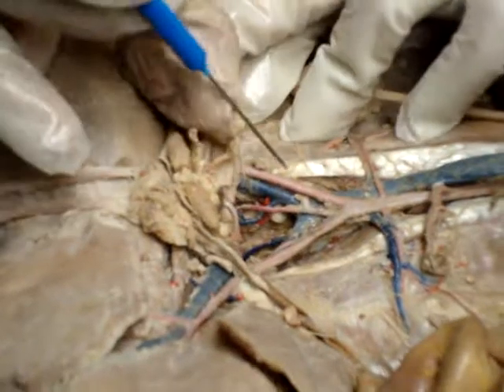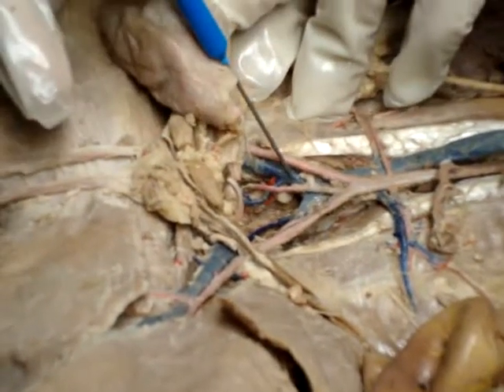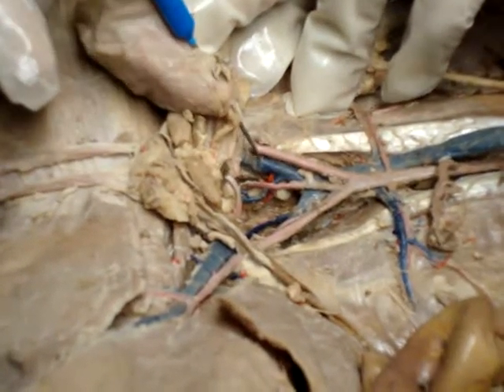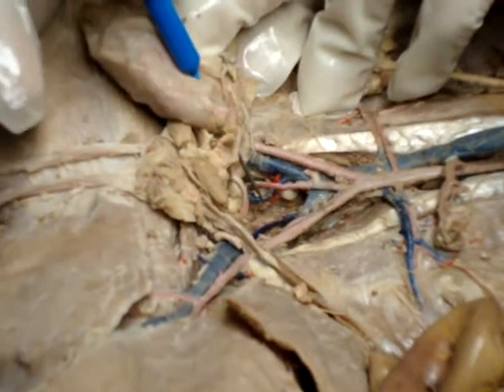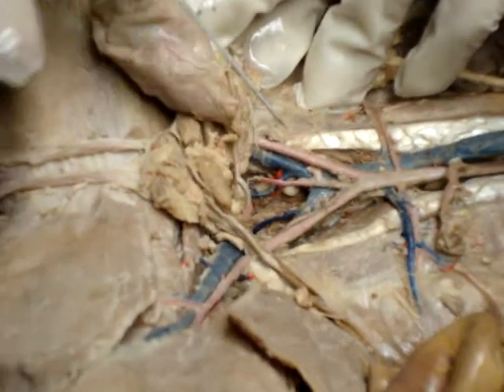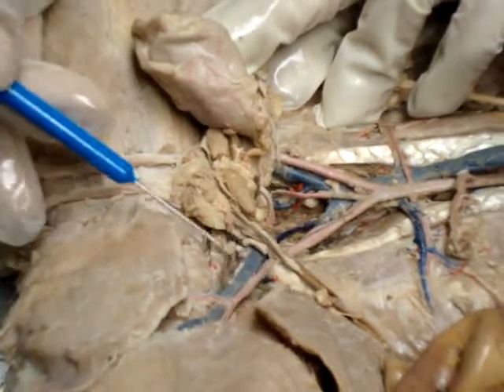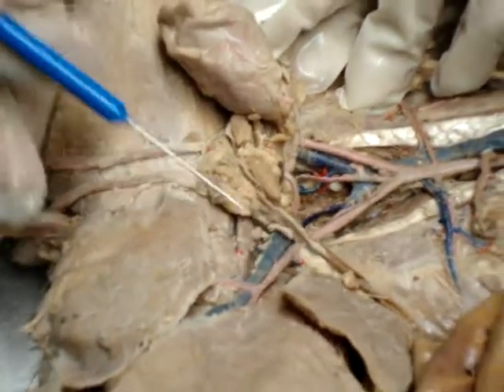On this side, this would be the common iliac vein. This would be the external iliac vein, and then this one would be the internal iliac vein. And then this is the femoral vein, and this is the femoral artery.